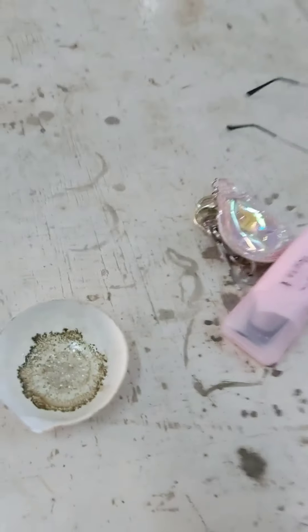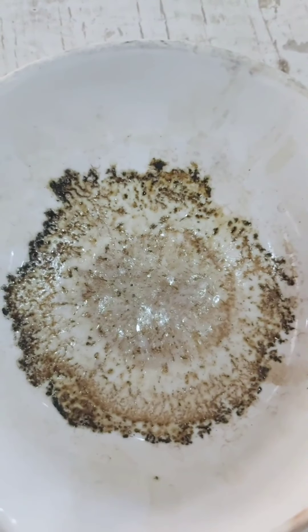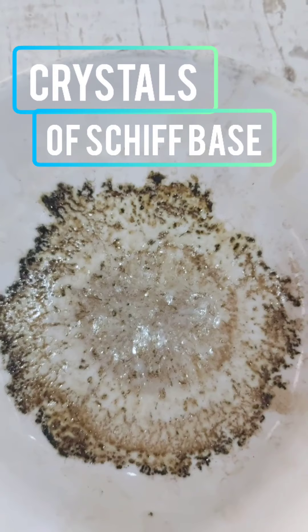I'm happy that my students are now regular and performing all the experiments one by one — they are on experiment number three now, which is a great success. I also want to show you the Schiff base that another group prepared day before yesterday: it turned into beautiful crystals after 24 hours. I have posted a video showing the whole experimental process and the students who prepared this compound.